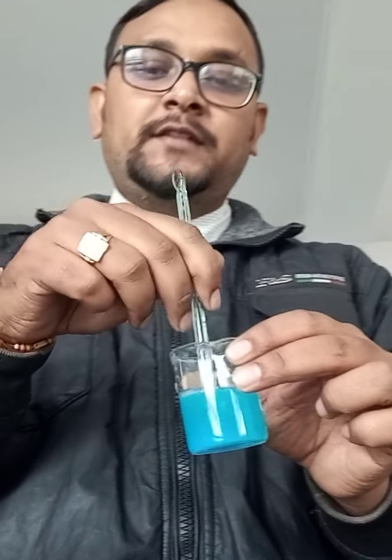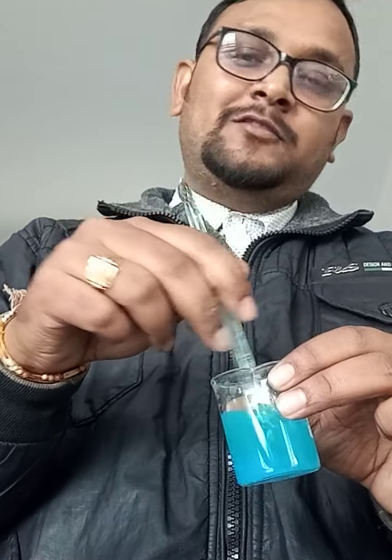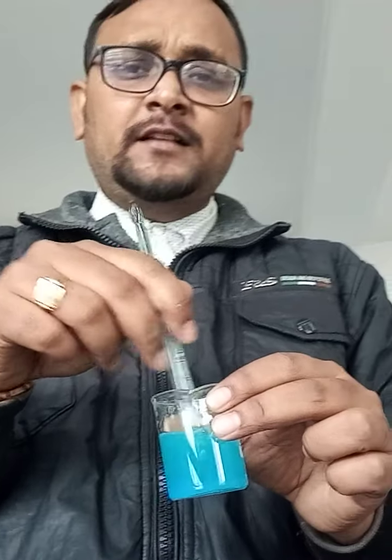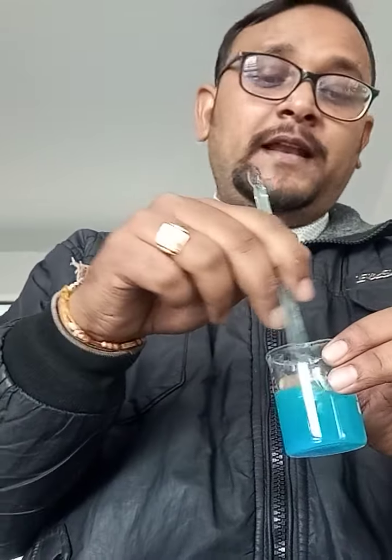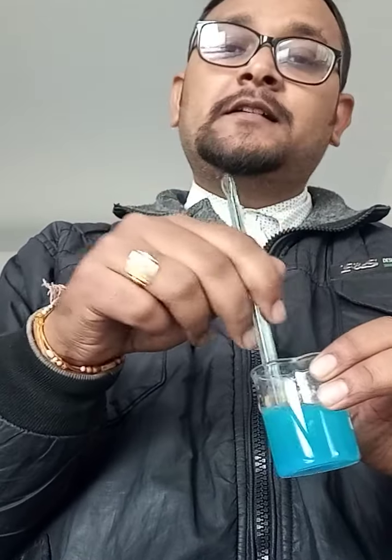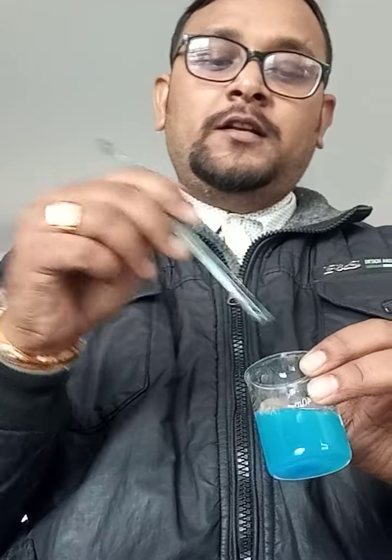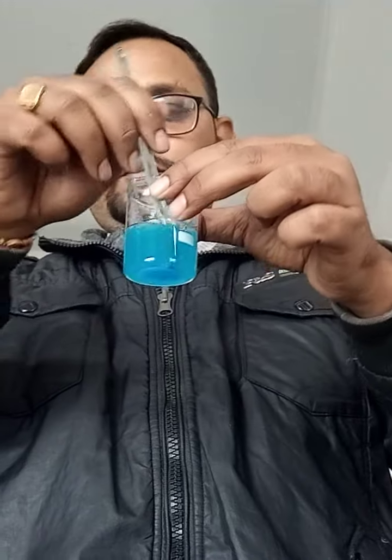So here I am taking copper sulphate. My dear students, copper sulphate is acting as a source of sulphate. You can go for any other sulphate as well. And we will find out what will happen with any salt containing sulphate radical. You can see it is almost dissolved, right? It is almost dissolved. So we will see what will happen to the salt.